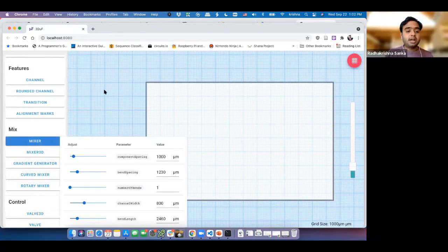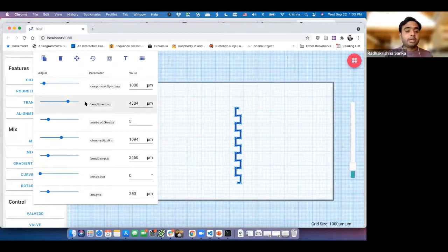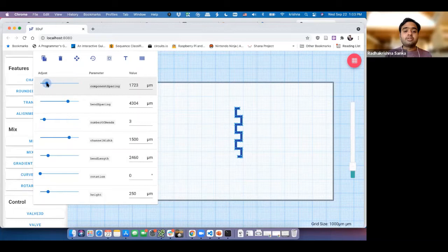So as I said before, you can basically add a new component. You can have different parameters for this, and then you can change the number of bends to something else, maybe something smaller. And then you can change the channel width to this. Now, if you were doing this manually, you would spend a lot of time modifying and messing around with the code base, with the designs, and trying to make sure that everything is parametric and actually procedurally generated. Similarly, by double clicking on any component, I have all these same properties which come up, which let me change the different aspects of this design. And so this way you'll have complete control of how you do the design. We also have an additional slider here called component spacing, which will save onto the design file so that in case you ever want to check later to make sure that the component spacing around this component is correct or not, you can utilize this parameter.